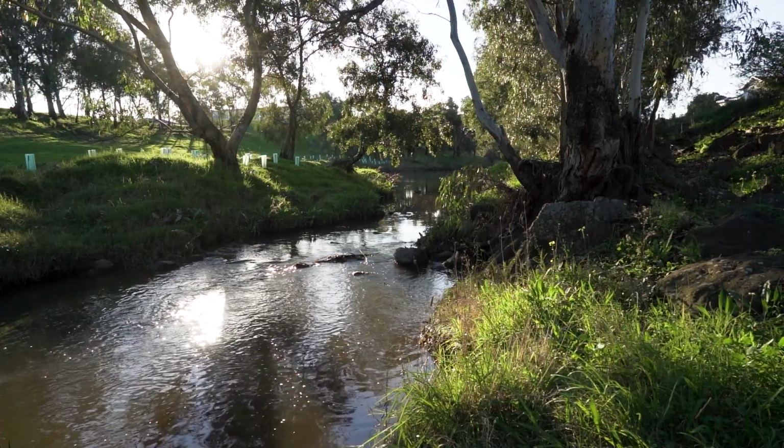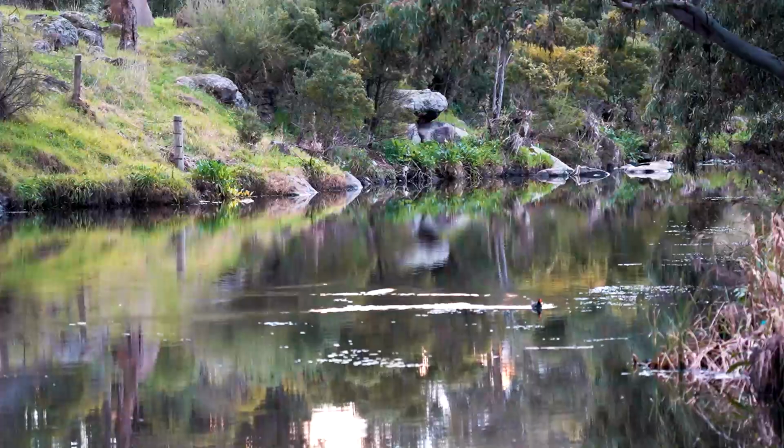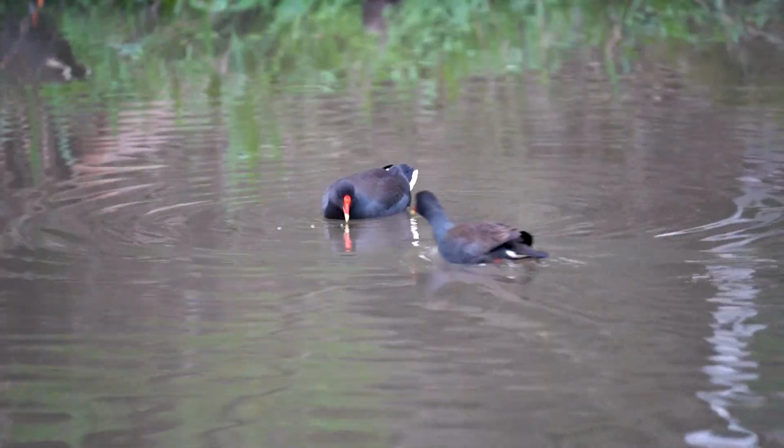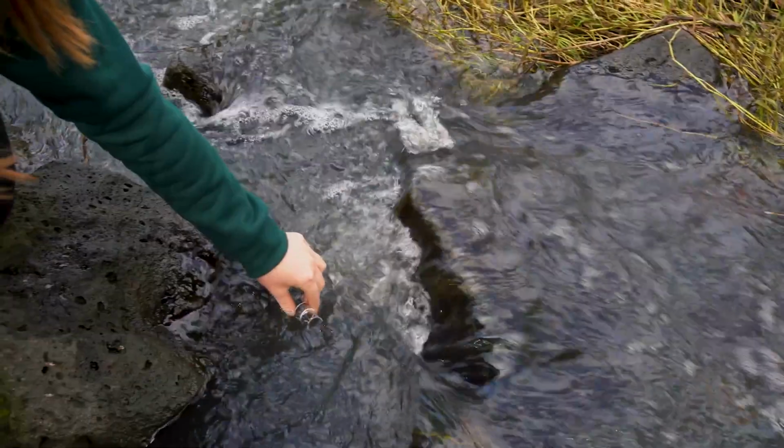Hi, my name's Emma and I'm here at Coleroy Creek with Science for All and the Coleroy Creek Neighbourhood Community House. Today we're going to be doing some water testing to have a look at the water quality of the creek. Coleroy Creek is home to a lot of different native animals and plants, and it's really important that this water quality is monitored so that the creek continues to provide that important habitat for these species. Today we're going to be looking at several different factors of water quality, including temperature, pH, ammonium concentration, dissolved oxygen, and conductivity. So we're going to start with temperature.